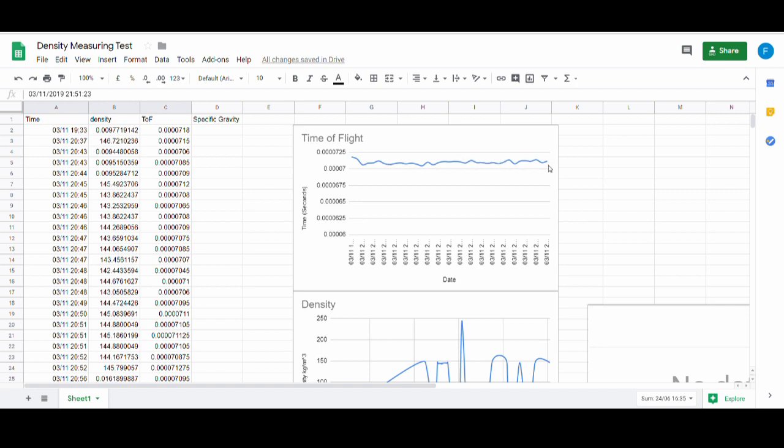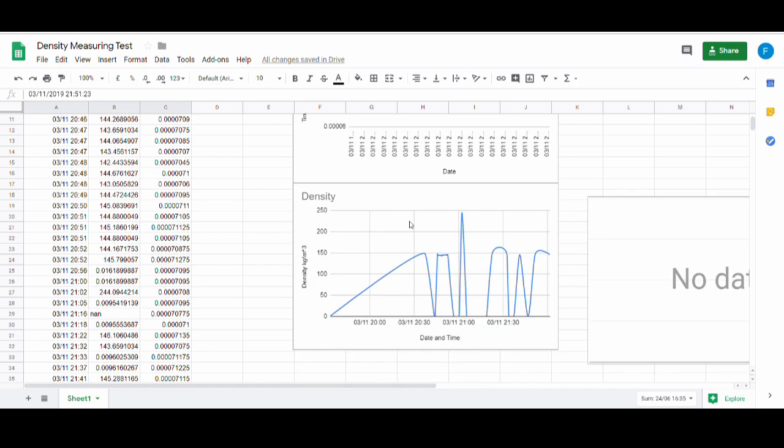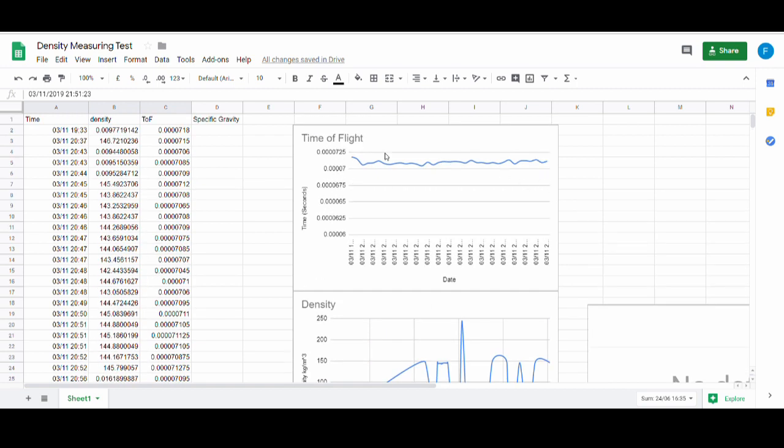So what's important, though, across all of these, even the garbage values, is that the time of flight, which is what we're basing everything off, is consistent. So that means that's a very good sign. You can see here the density is kind of up and down the place, and that's because of those calibration issues I was mentioning before. But yeah, so far so good, quite promising that we've got the time of flight consistent. We'd expect to see this increase as the density drops. So hopefully that will steadily go up, and then once we get the density issues sorted out, we can get some actual accurate density readings.